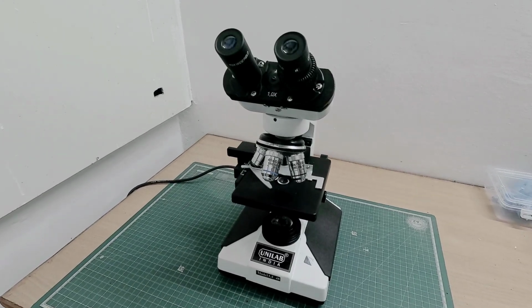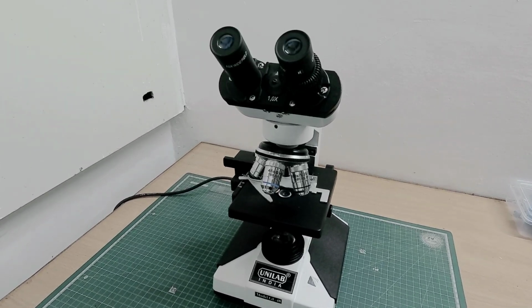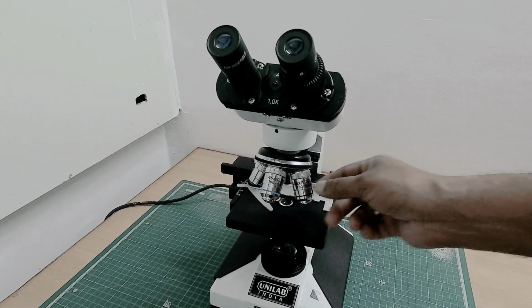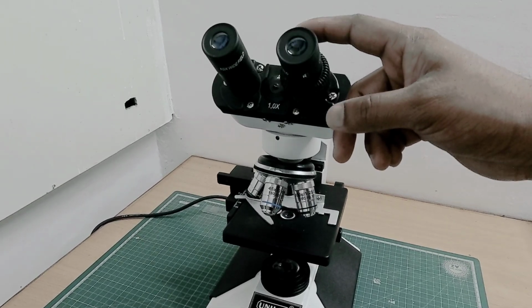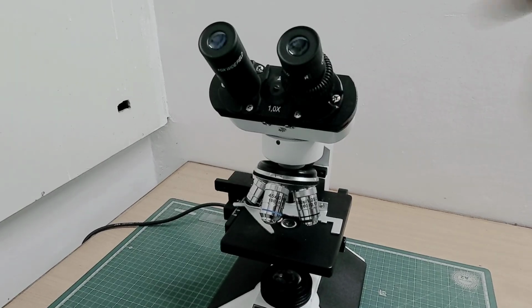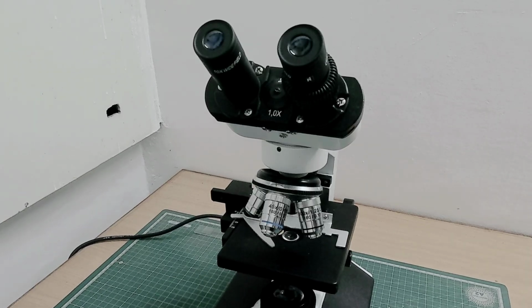The compound microscope works on the principle of refraction of light through multiple convex lenses. It uses a two lens system. The objective lens forms a real, inverted, magnified image. The eyepiece lens, the second one, further magnifies this image to form a virtual image that we observe. So technically, the microscope does not magnify the specimen directly. It magnifies the image formed by the objective.